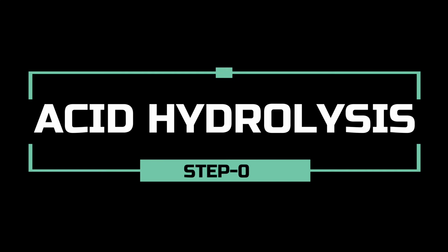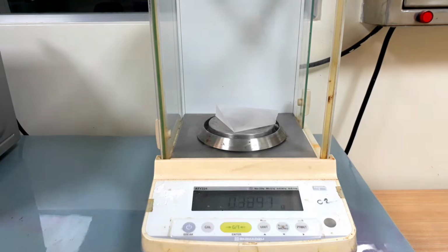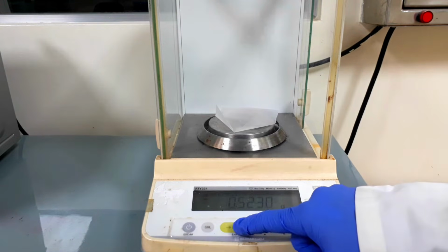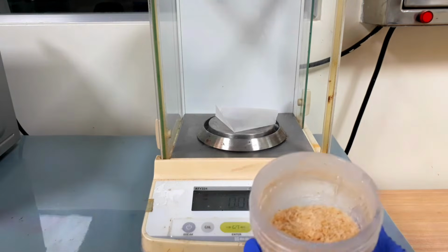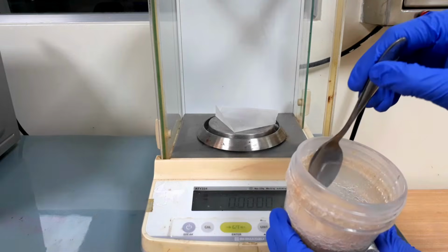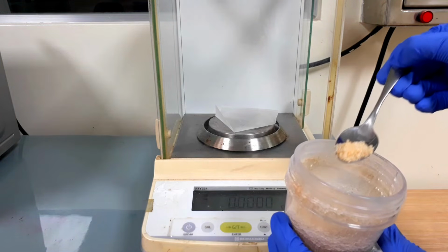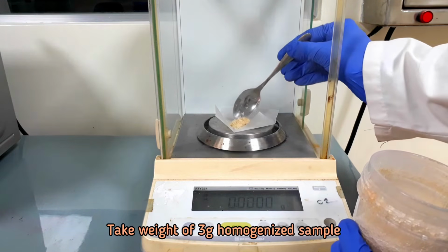Now we are going for the acid hydrolysis of the sample. Take 3 grams of the homogenized sample by weight.